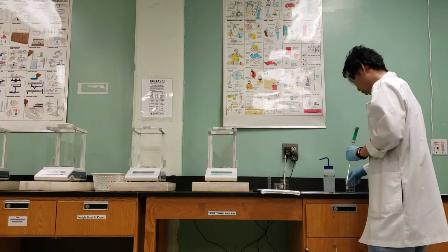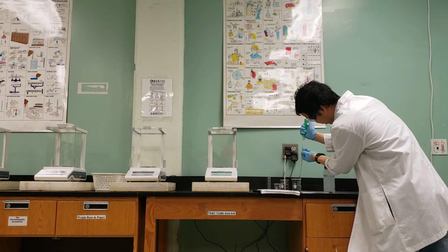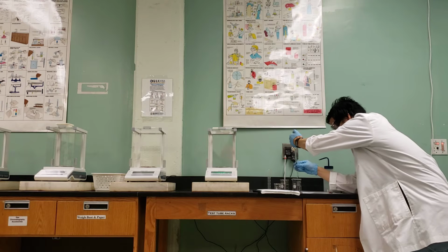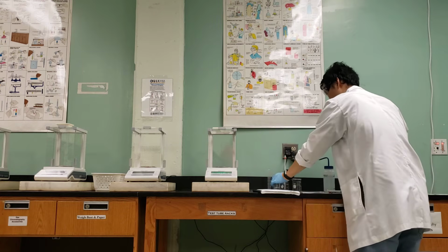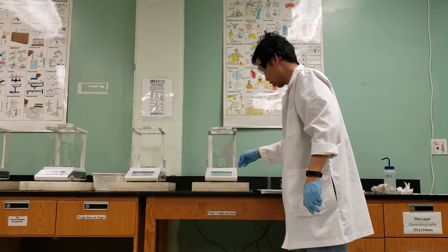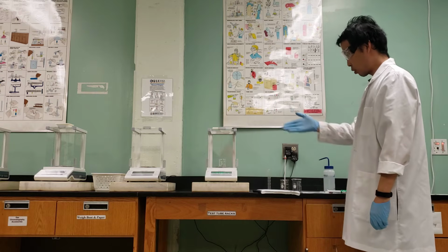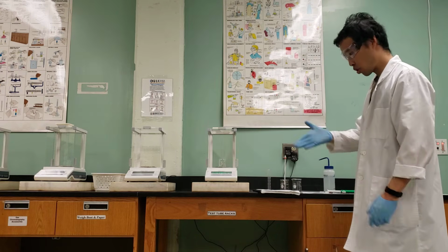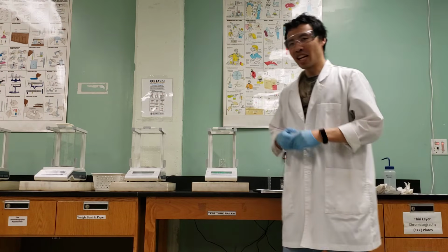I'm going to suck up 10 mils, go above the 10 mil mark. I cover it. I go down to the 10 mils. And then I empty the amount of interest into our beaker, the same beaker that we just used, so we know the mass of the empty. And this mass reads 40.384. Okay, so we're going to repeat this experiment. It says to repeat steps 2 to 6, meaning I would empty it, dry it, and then use the pipette again to get measurements in triplicate. So that is part B. So now we're just going to head over to the board.